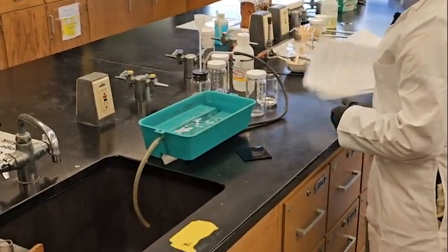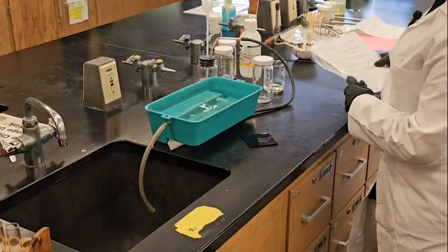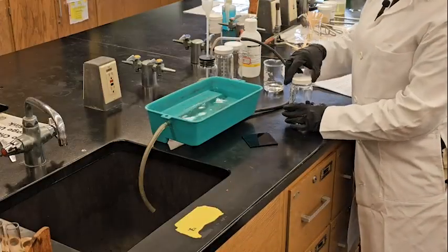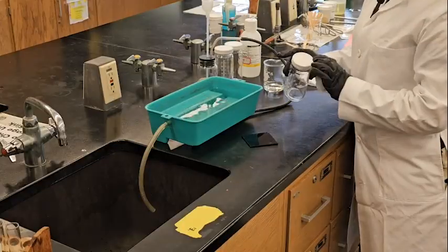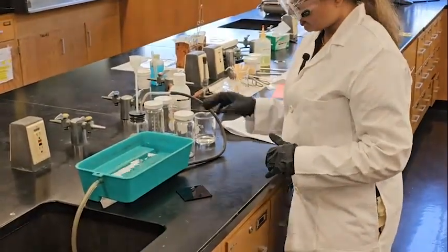We actually need 5 bottles to collect my oxygen. So I already have them here. I made a sign on the one which I'm going to use for part 3.